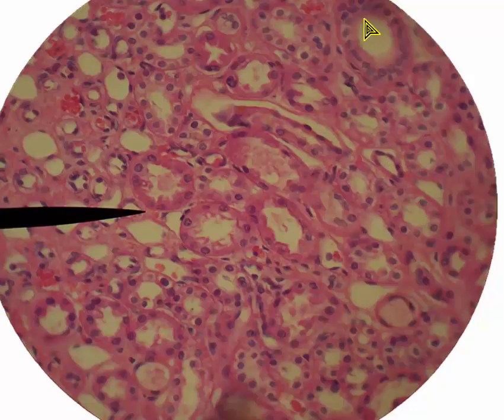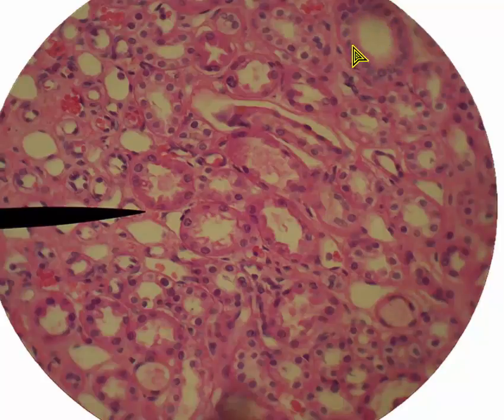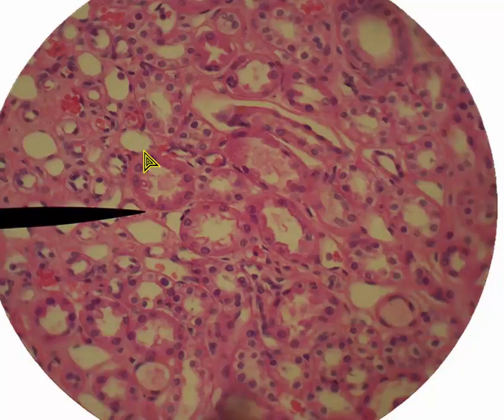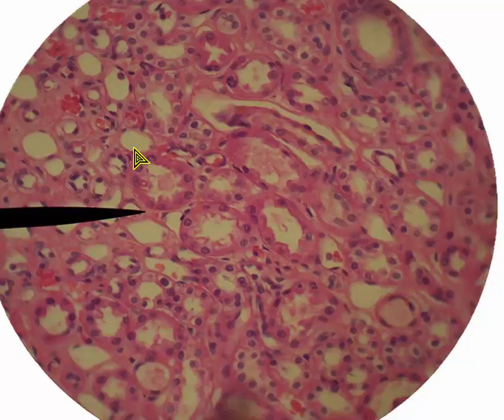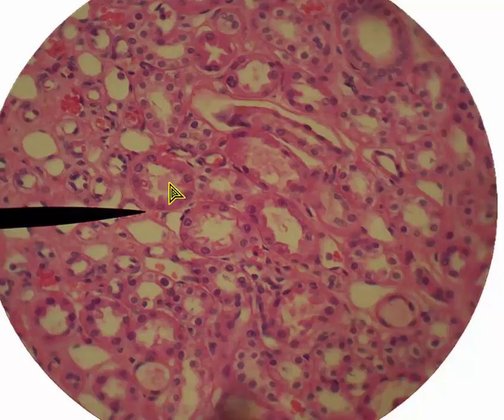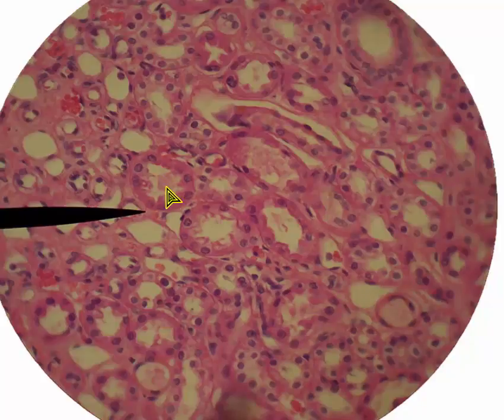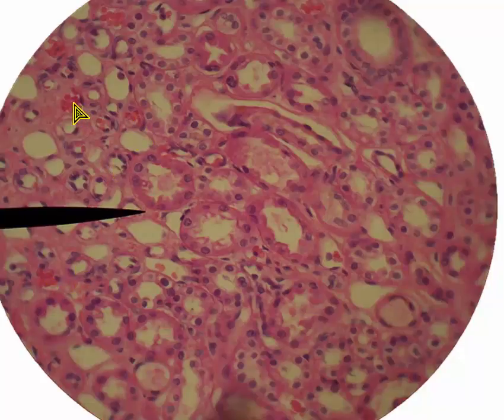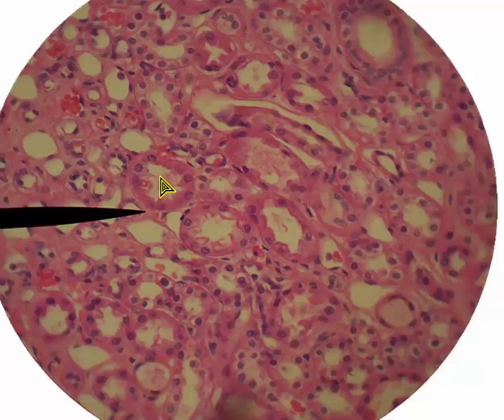Apart from that, we again see renal tubules. Notice that some of these tubules are rather large, rather thick in their walls — the epithelial cells that make up the wall are really thick. Then other areas where the cells making up the wall of the tubule are squamous, they're really thin. That's because as the nephron loop comes down, we tend to have that part of the loop having a really thin wall. It's called the thin descending limb. And then the thicker parts are usually part of the ascending limb. There are also blood vessels here — the blood vessels that you see here are part of what we call the vasa recta, which come down and go back up in the medulla in the same manner that the tubules do in terms of the nephron loop.